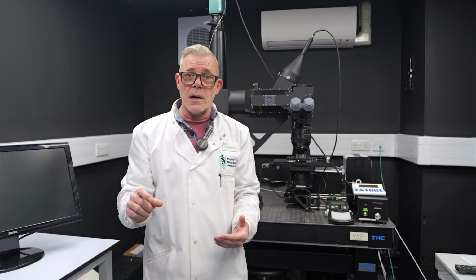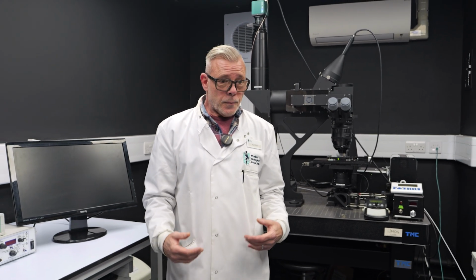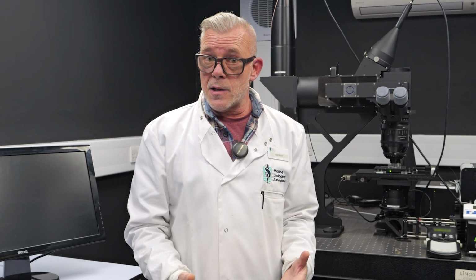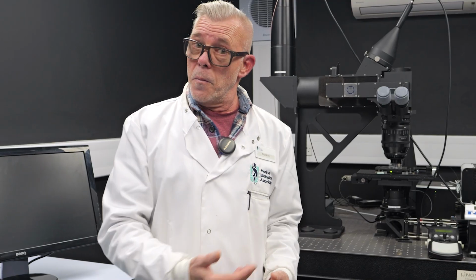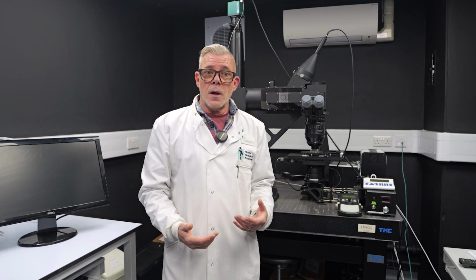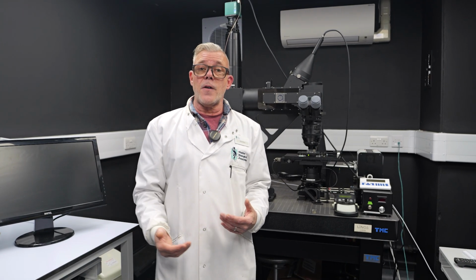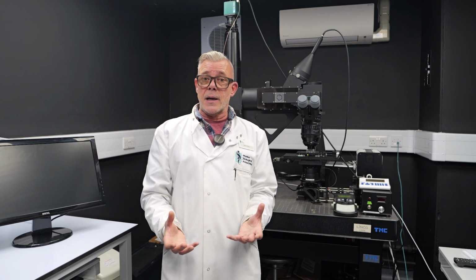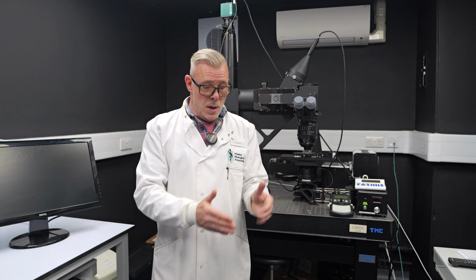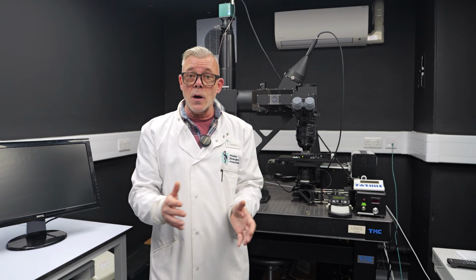Having the Mesolens microscope at the Marine Biological Association enables us to conduct more and more research. We've now spent around a year taking measurements of seawater samples from the Western English Channel, and that gives us very important information that enables us to say something about which species are contributing more to photosynthesis within a whole phytoplankton population, and how that changes over time when we see these very large shifts in species that tend to occur seasonally.